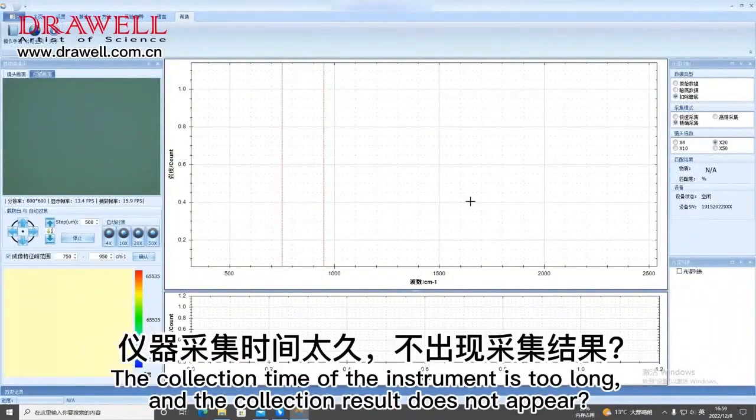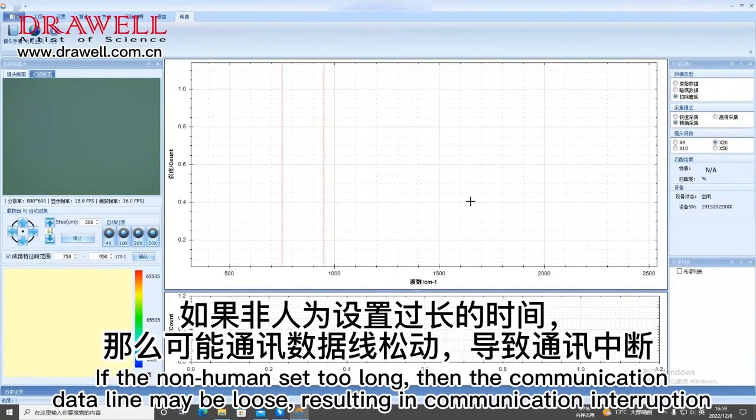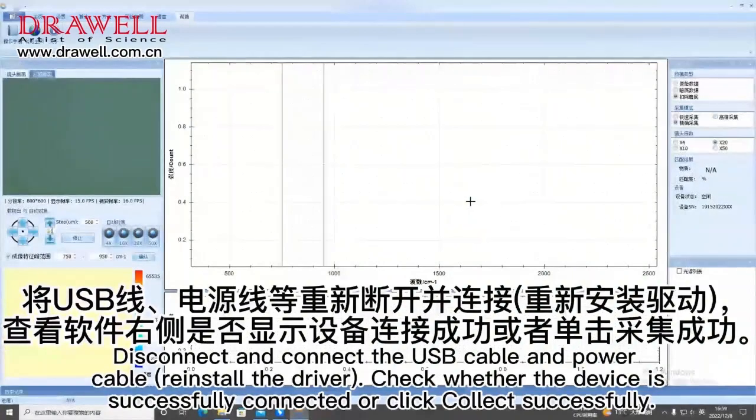The collection time of the instrument is too long, and the collection result does not appear. Check whether the integration time is set too long or the average number of times is set too high. If it is not set too long, then the communication data line may be loose, resulting in communication interruption. Disconnect and reconnect the USB cable and power cable. Reinstall the driver. Check whether the device is successfully connected, or click collect.